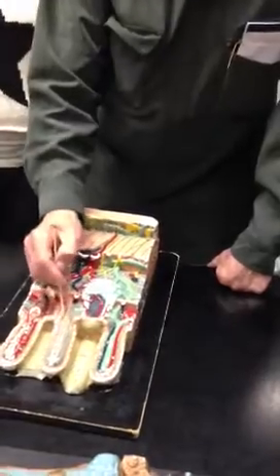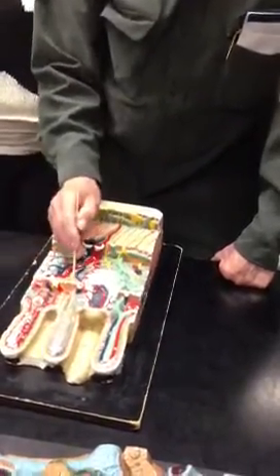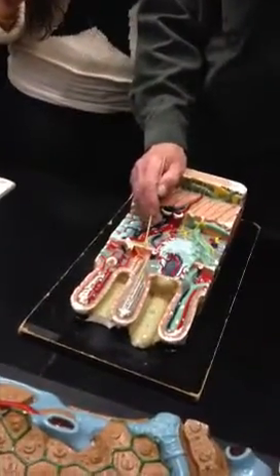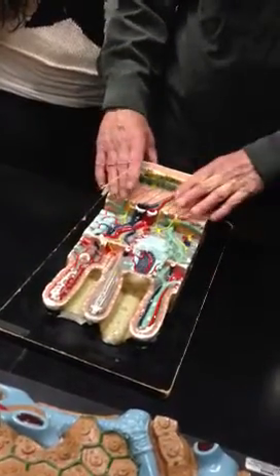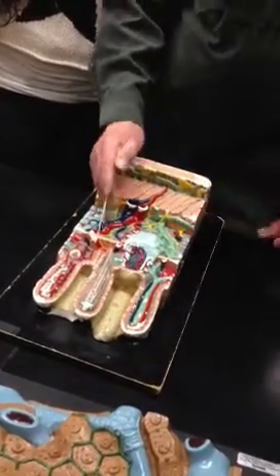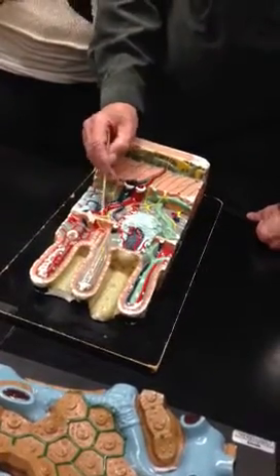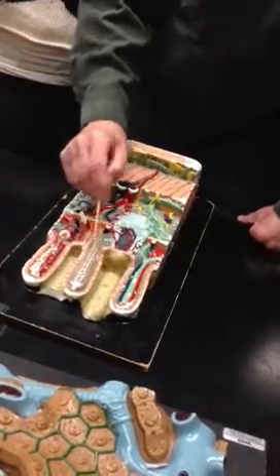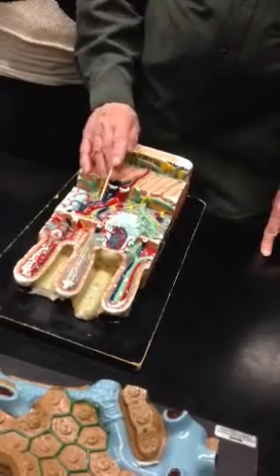What you see here, these pink lines moving up, they come from this very thin muscle layer called the muscularis mucosa, because this is a muscle layer in the mucosal layer. Okay, it's not in the muscle layer, in the muscularis, it's in the mucosa. So this is called muscularis mucosa, and it sends muscle fibers up into the villi. They have a relatively important function.